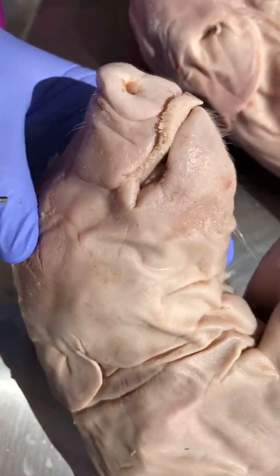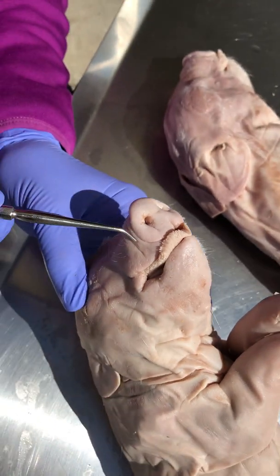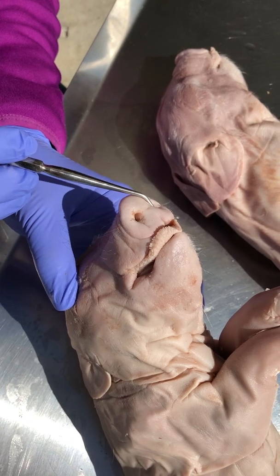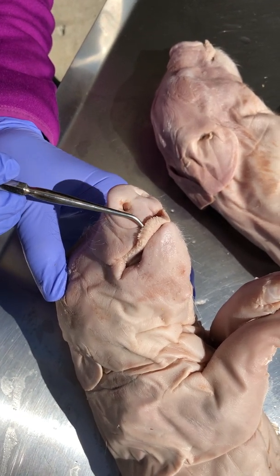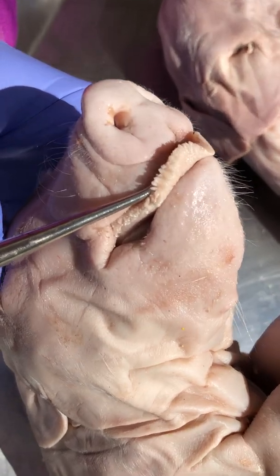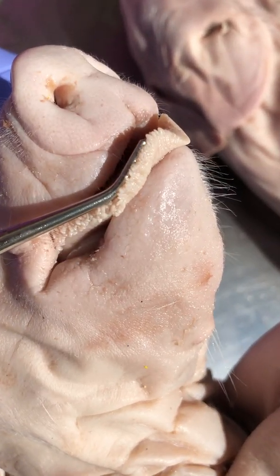Here's the snout. External nares. The tongue, and then these fluffy structures along the edge of the tongue — papillae.